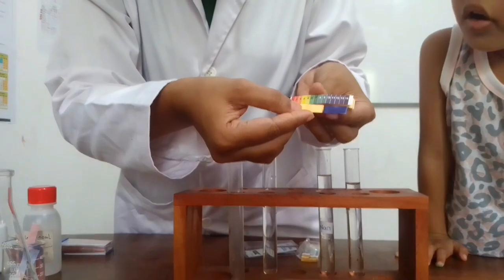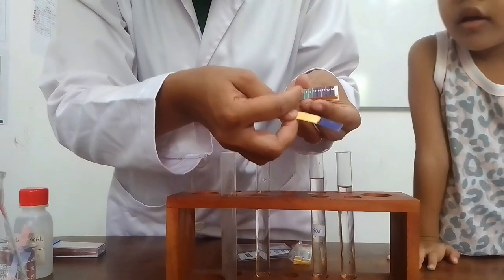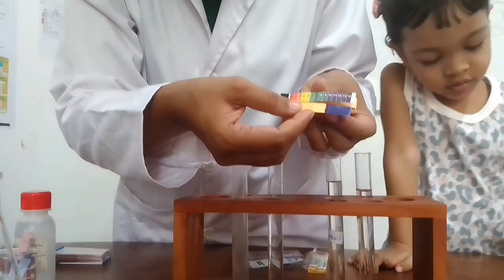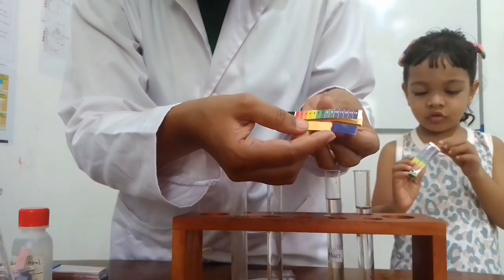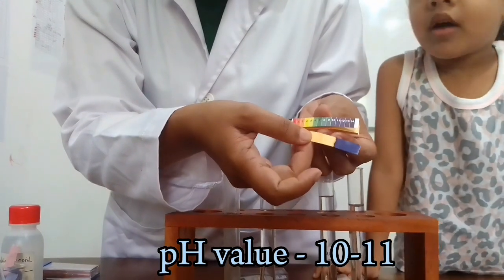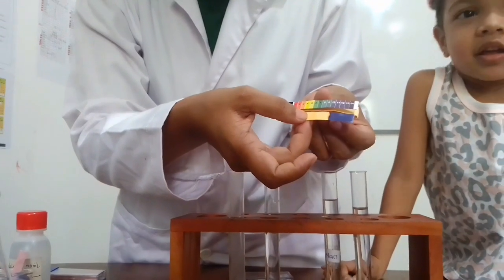Here, what can you see? It is more than 7, right? This is 7. This is less than 7 values and this is more than 7 values. This color change with sodium hydroxide solution is more than 7. It's about 10, 11 like that.